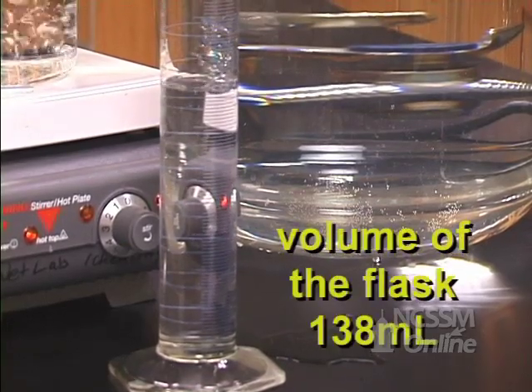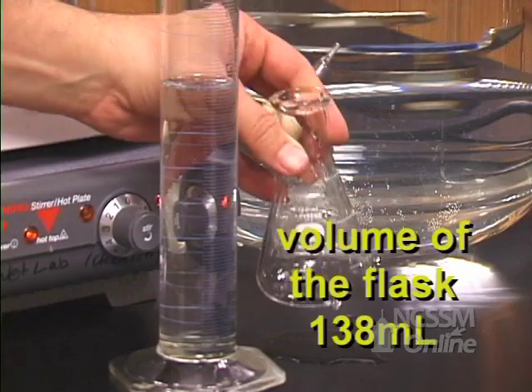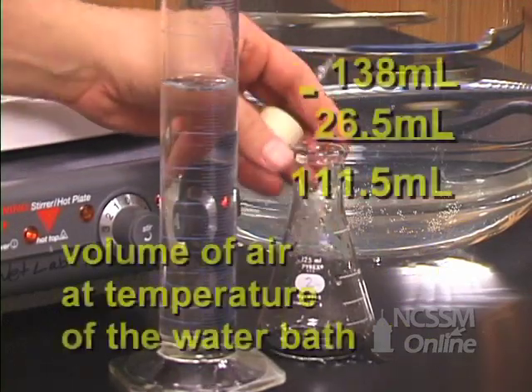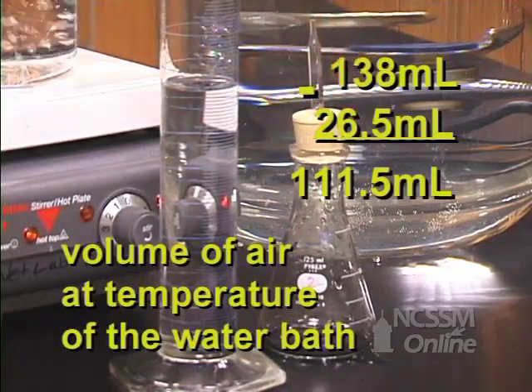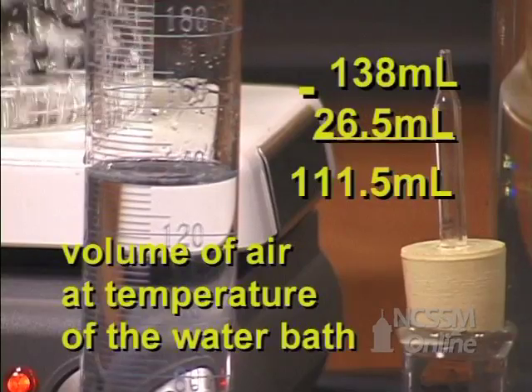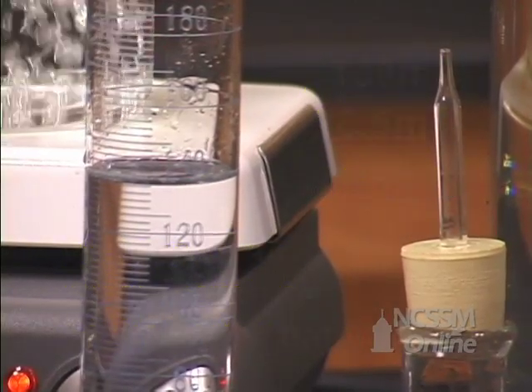The volume is 138 milliliters. The difference between the volume of water required to completely fill the flask and the water that was in the flask after cooling is the volume of the air at the temperature of the large water bath.